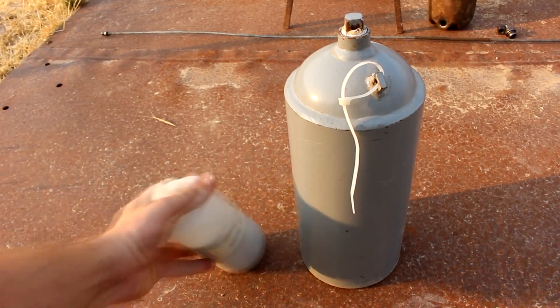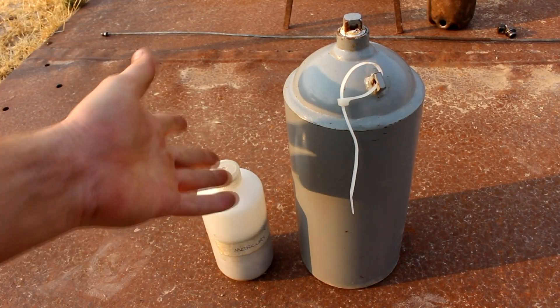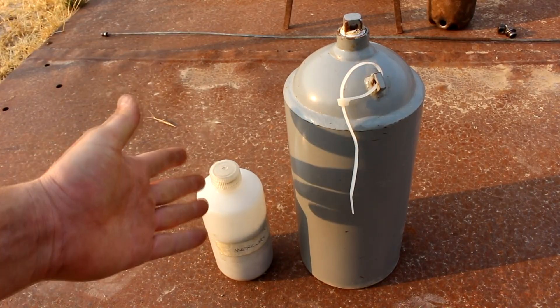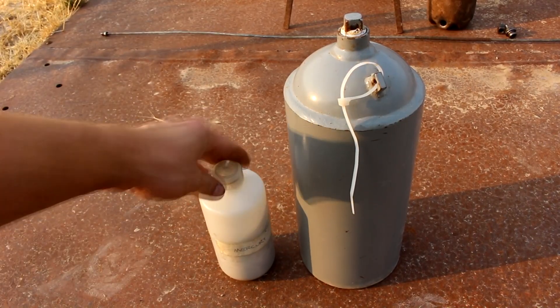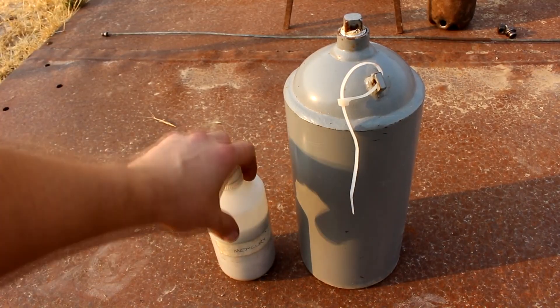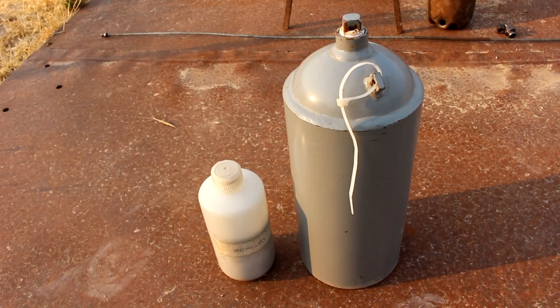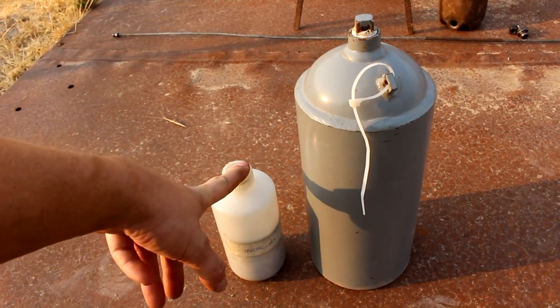But what I do have quite a lot of, that does absolutely need to get distilled, is this here. This stuff was actually used in mining, and it's got a lot of lead, copper, and zinc dissolved into it. I can run this through a filter and it'll look shiny for a few days, but once the air gets into it, it'll oxidize and it looks terrible again. Also it's really sticky — it likes to stick to stuff.